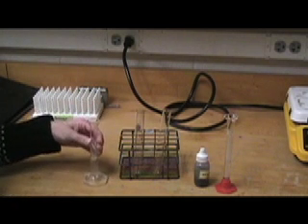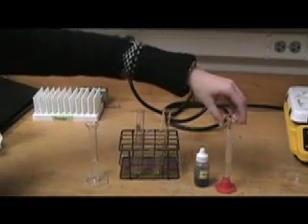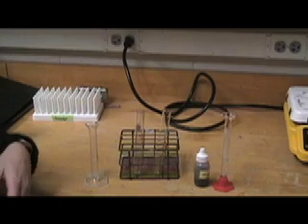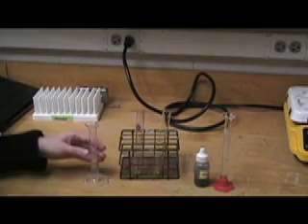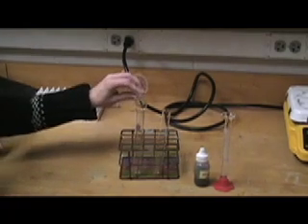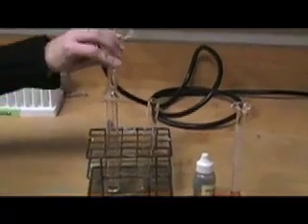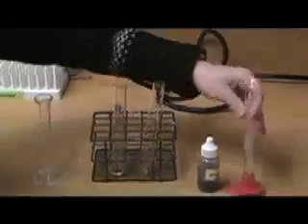I have a graduated cylinder with water, which will be our control, and then a graduated cylinder of gelatin, which will be our test. I'm going to pour five milliliters of each into the test tubes.